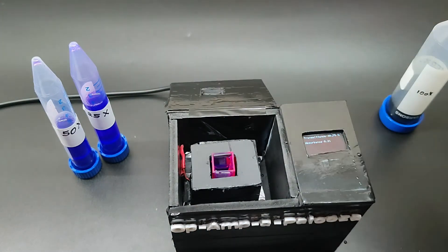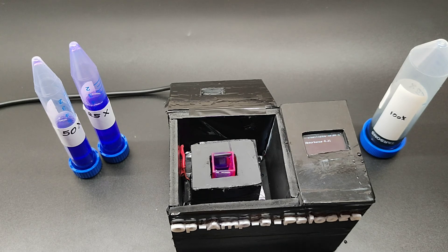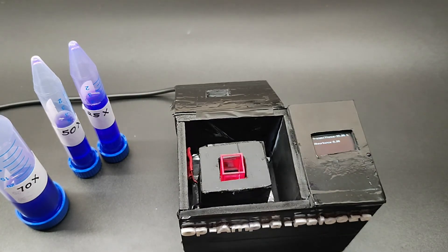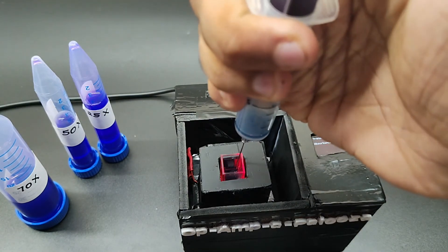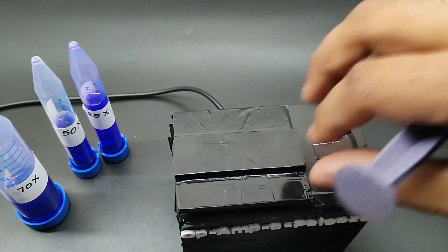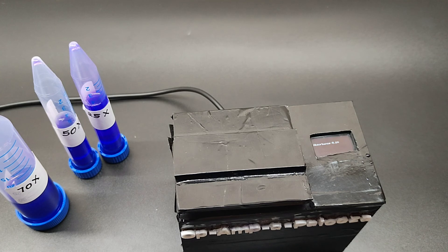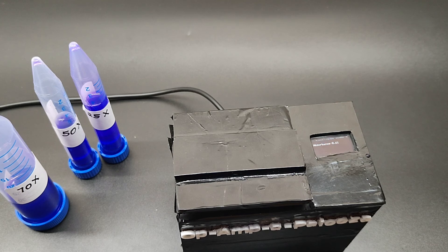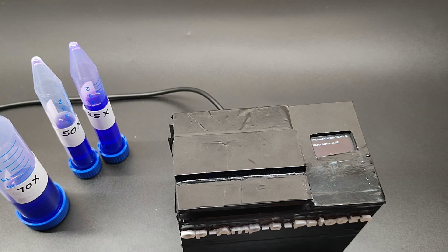Next I will test the undiluted 100x solution. I will remove the 70x from the cuvette and add a new cuvette for the 100x. Now I am going to add the last solution — the undiluted 100x. As you can see, only 15% light transmittance is shown, and the absorbance is 0.62.